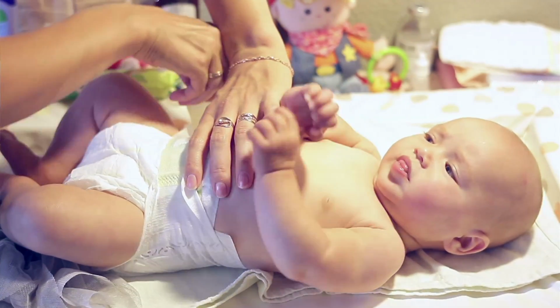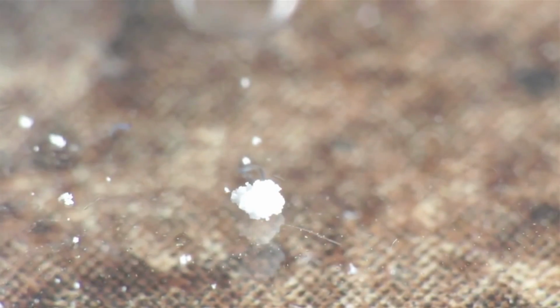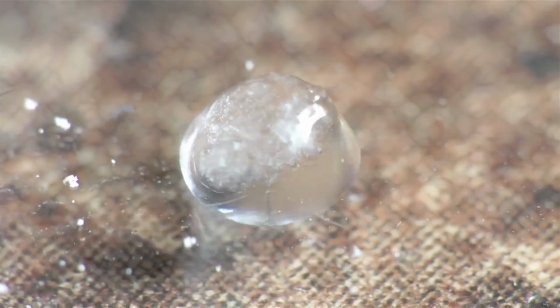So we looked through the literature and we just found the most well-characterized swellable polymer there is, which turns out to be the thing that is used in baby diapers. So when baby diapers absorb water, there's polymers in here that will swell up to become very, very large. That's how they absorb so much water.